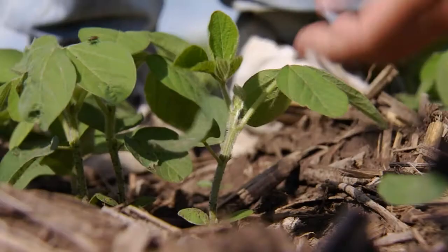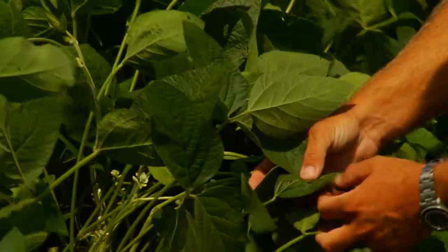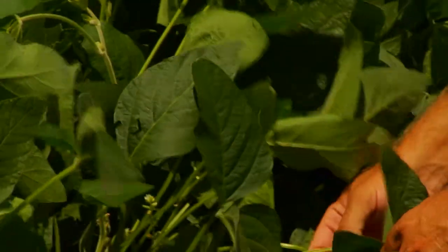Some of the common mistakes that we run into with the samples we receive — sometimes they've taken the wrong part of the plant. They may take the whole plant when they might just need a particular leaf, or vice versa, where they're going to send in just a very small leaf when we need more plant material. When the plants are young, we're going to want to take the entire plant. As that plant starts to grow and mature, then we're going to shift our focus to a different leaf.